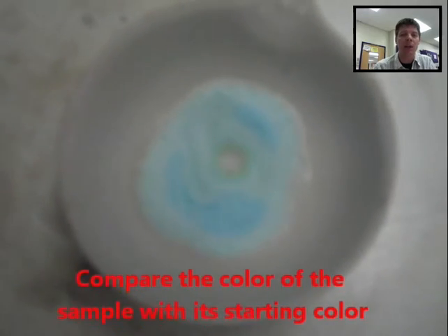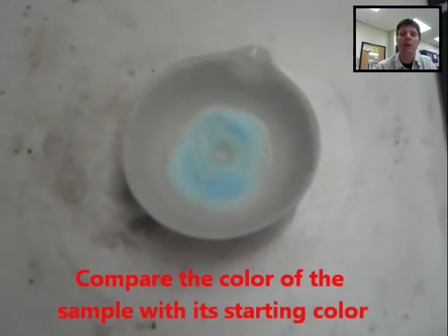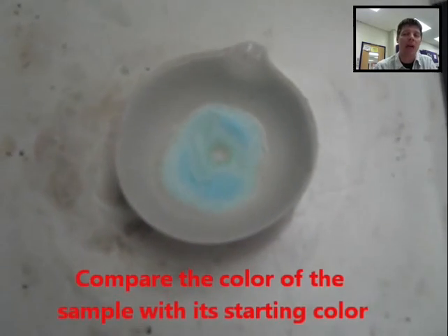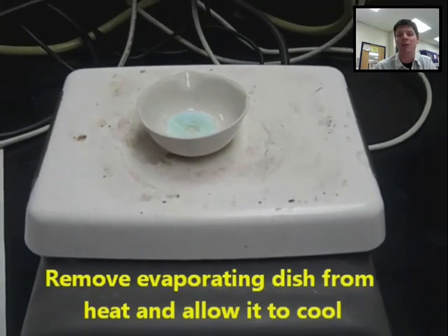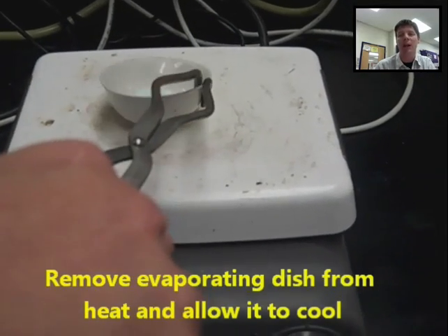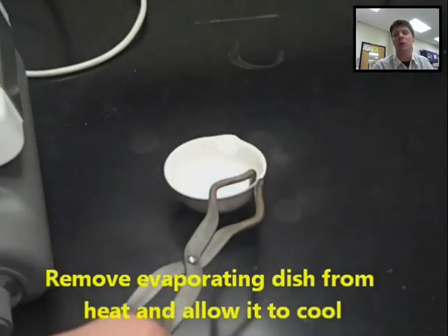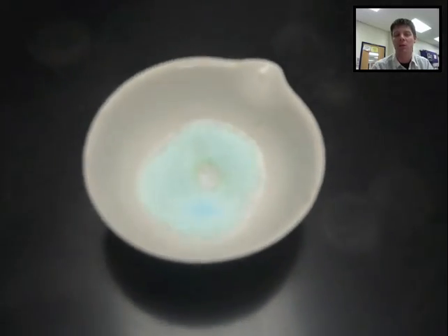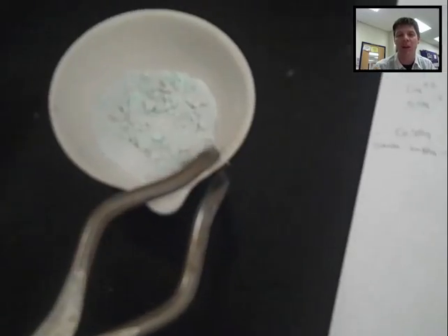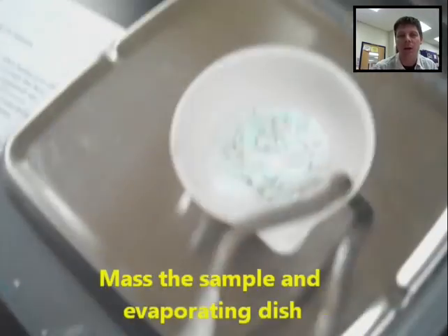You can see with heating that the sample is actually changing color, and this is because the sample is actually being dried. It's somewhat analogous to what a wet sponge looks like. Imagine a wet blue sponge versus what the sponge looks like when it's been dried out — the blue is much less vivid, it's a lot lighter in color.